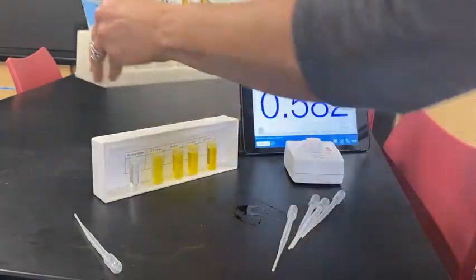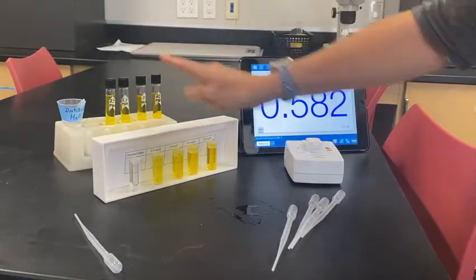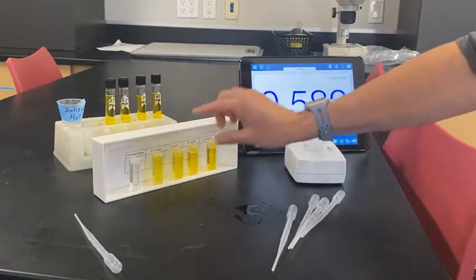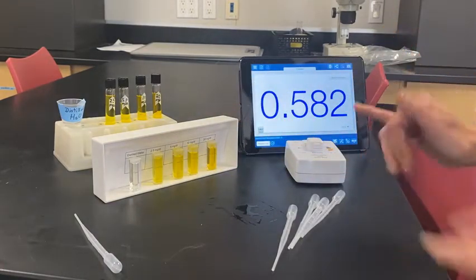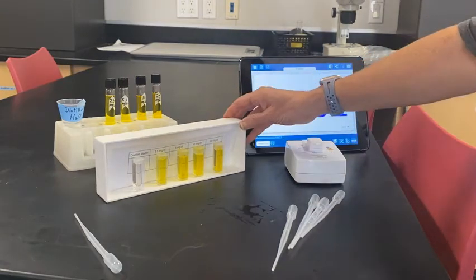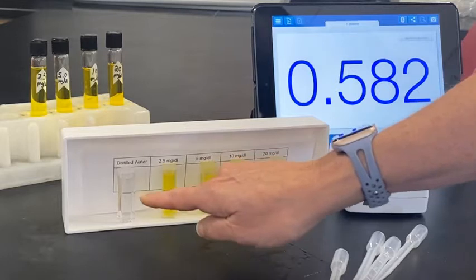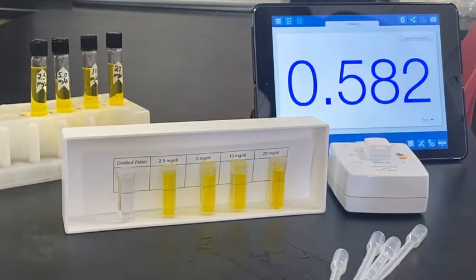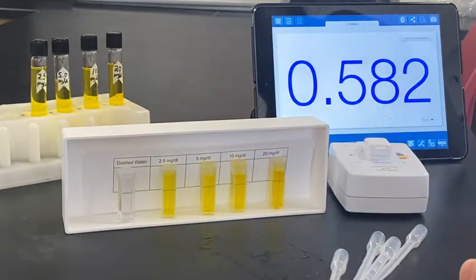Once you transfer from the stock solution into the cuvette, you should keep very good track of what's in each cuvette. You can see here I've made a simple paper for you — distilled water, and so on — so that you can keep track of the known bilirubin serums.